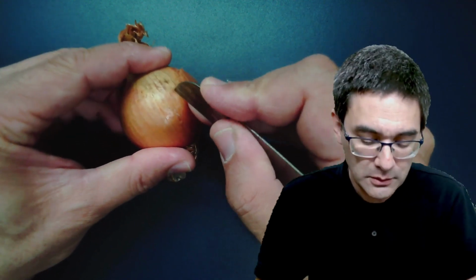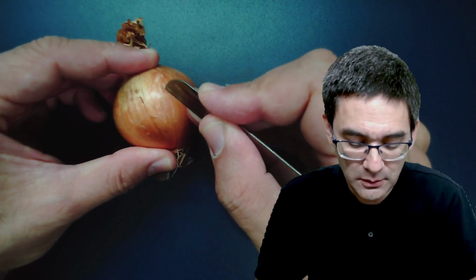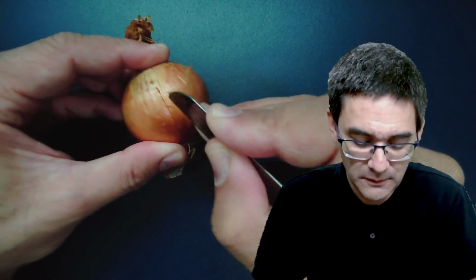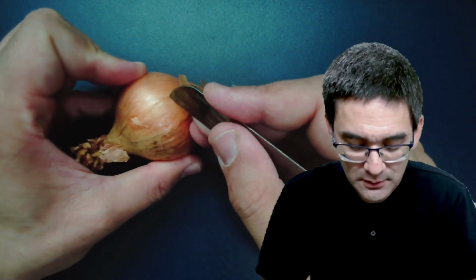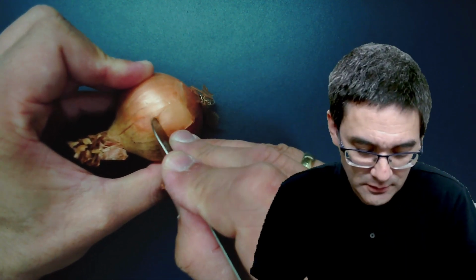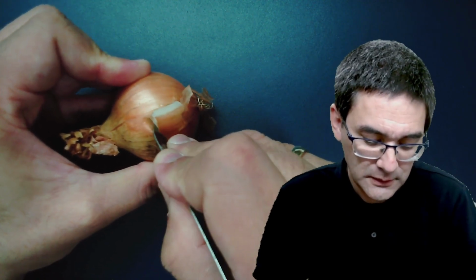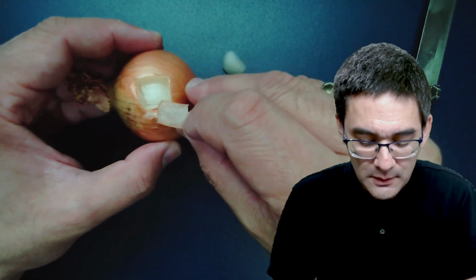And I like to usually not simply cut apart the whole onion, but I like to usually cut out a square. So I make a cut here, a parallel cut over here. So there are two cuts. One is here, one is here. Okay. Then I turn the onion around and I make another cut here. So I'm actually cutting out a little rectangle. Up. See, the knife is a little bit dull. So, and this is basically what we get.